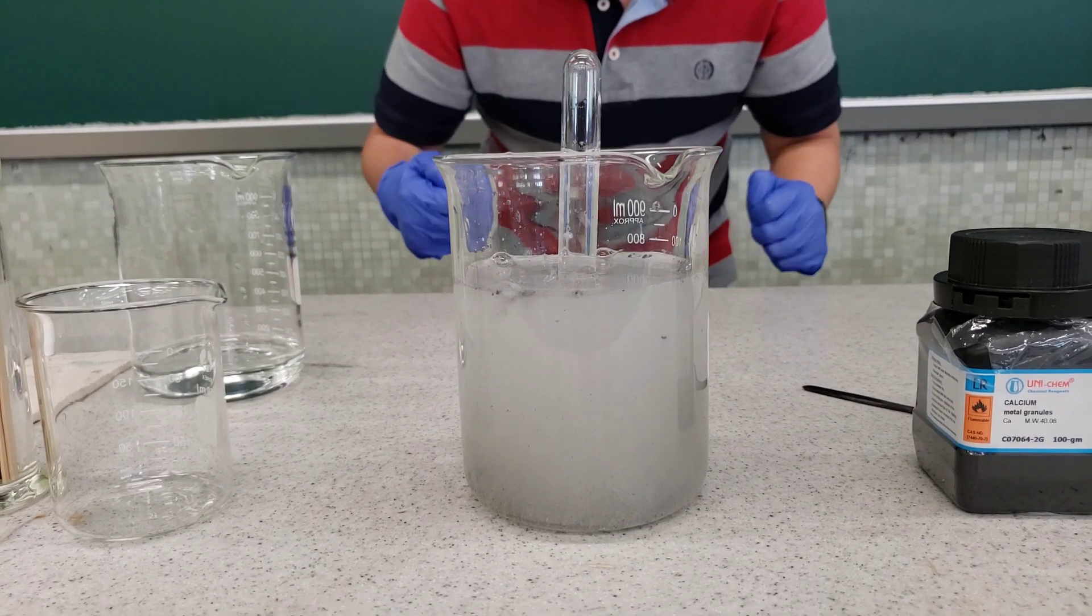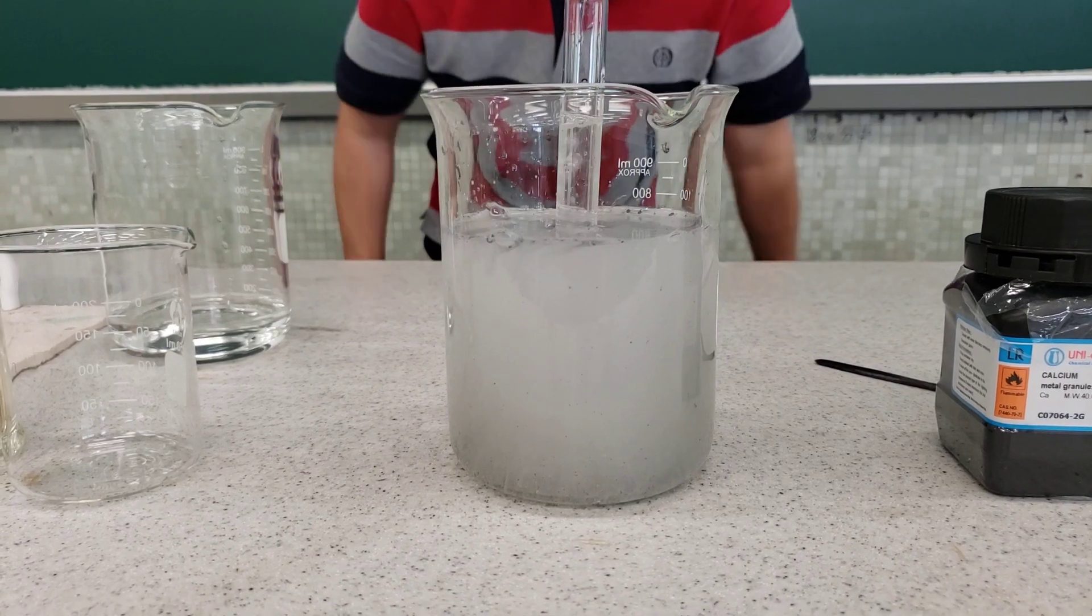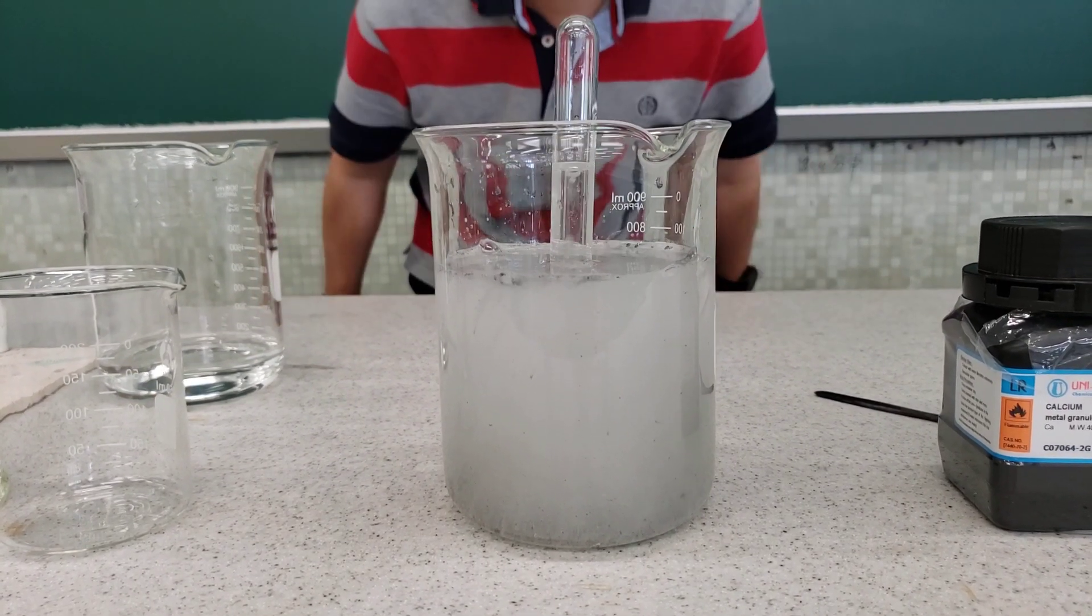During the reaction what do you observe? Can you see the calcium granules keep moving? Just like dancing in the water.